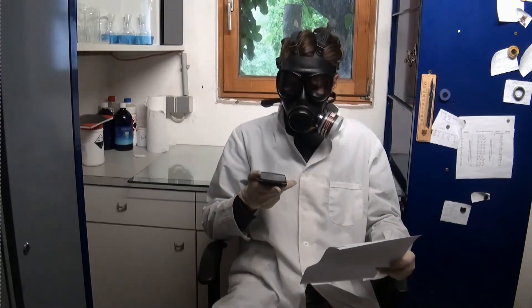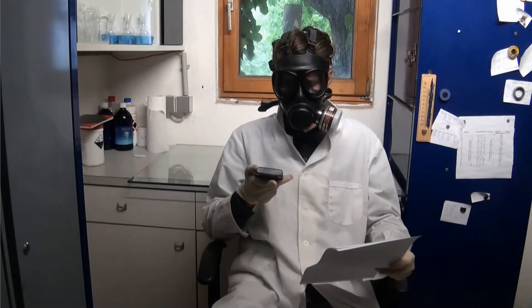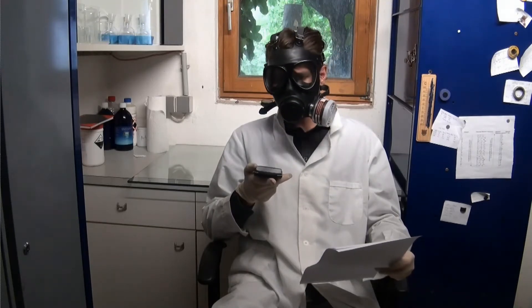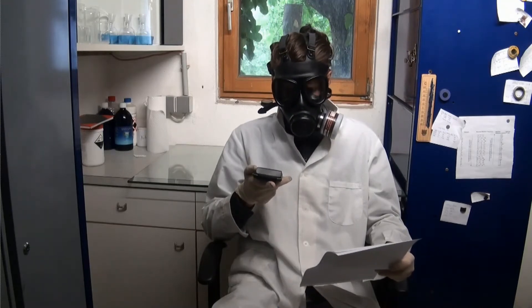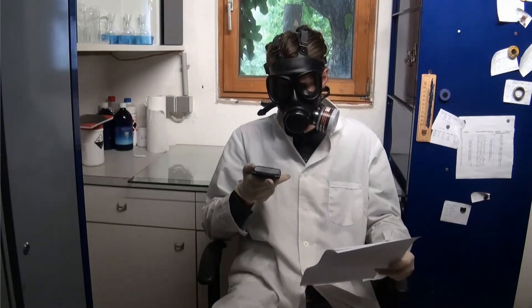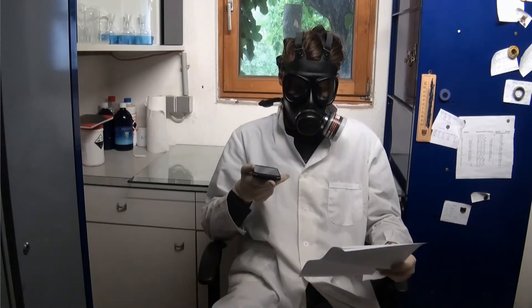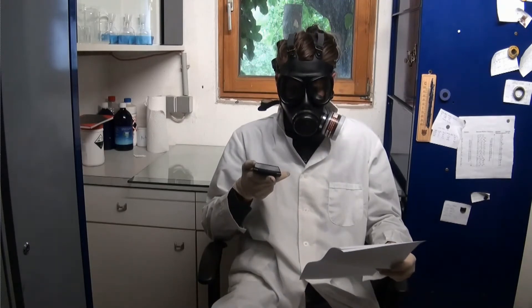The UV source for this would usually be a mercury vapor lamp which has a large output in the UV range. Those are usually extremely expensive and need special drivers. Now here is what I can afford.